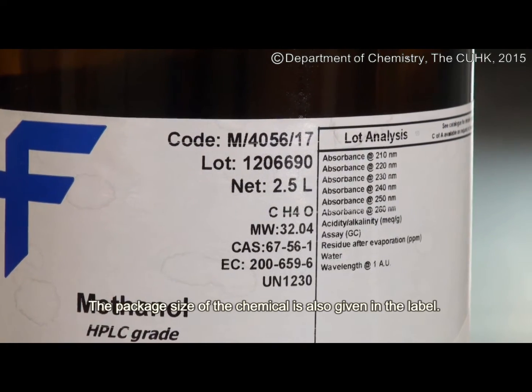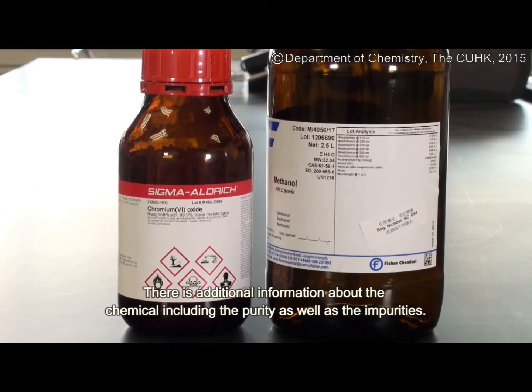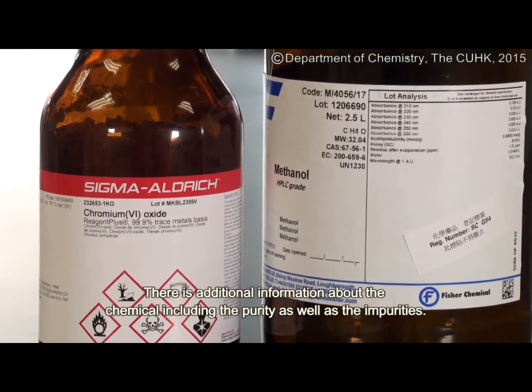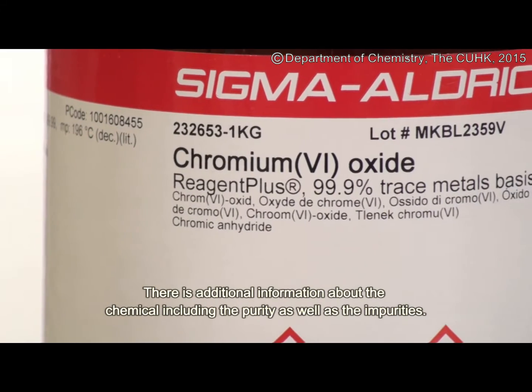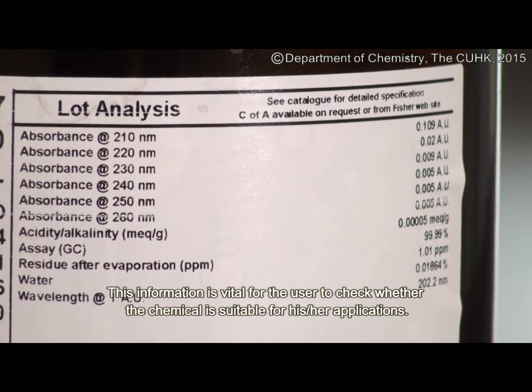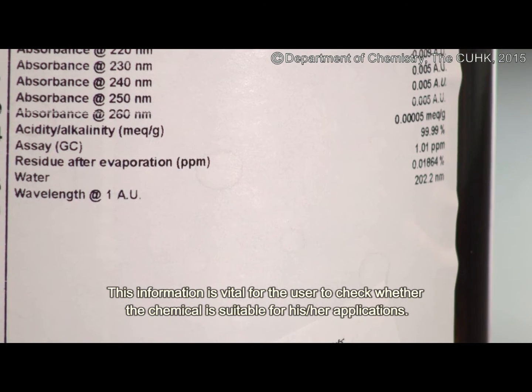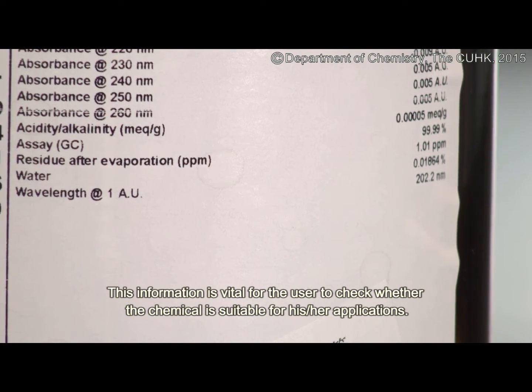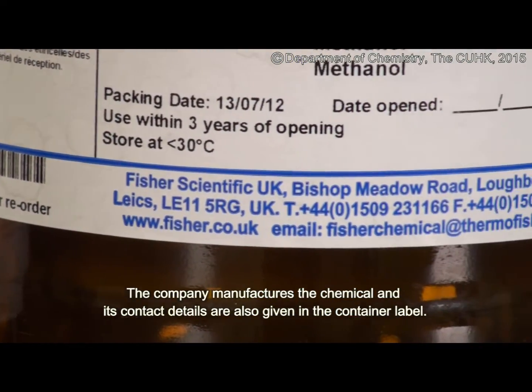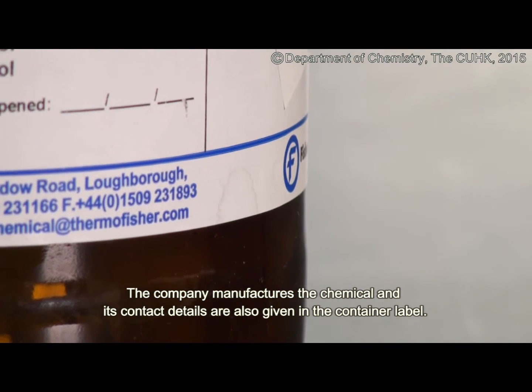The package size of the chemical is also given on the label. There is additional information about the chemical including the purity as well as the impurities. This information is vital for the user to check whether the chemical is suitable for his or her applications. The company that manufactures the chemical and its contact details are also given on the container label.